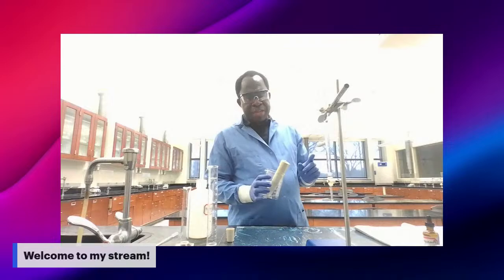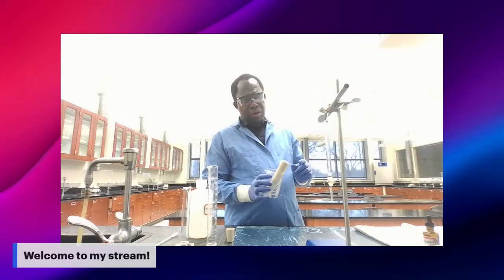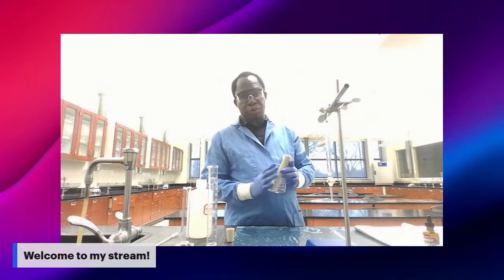One thing I want to remind you is that even before we move to this step, you have to measure the pH of your initial solution.